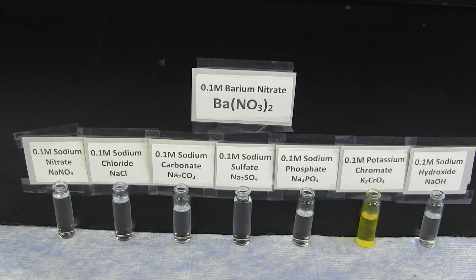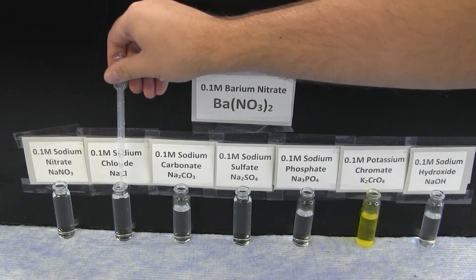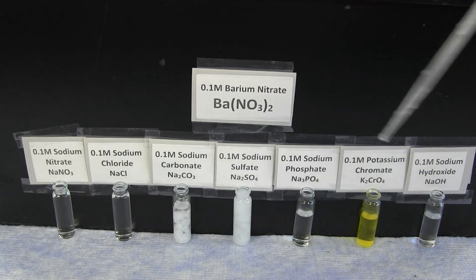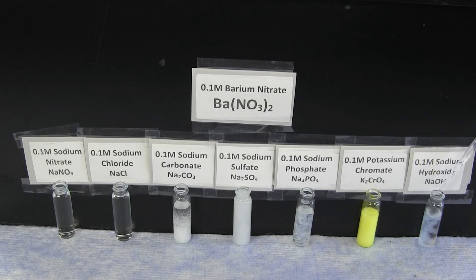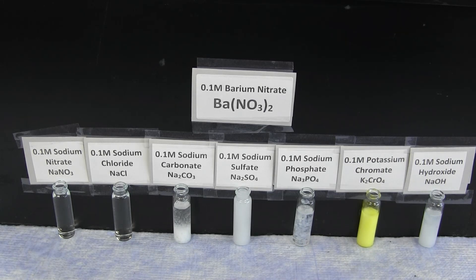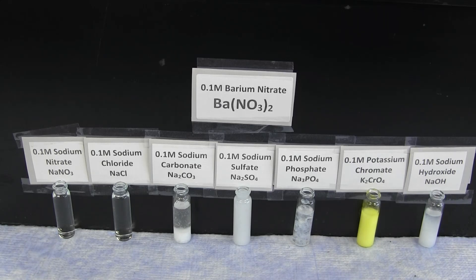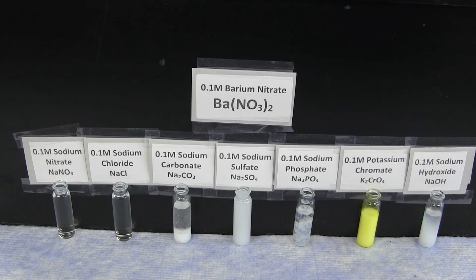The next reactions are those of the barium ion. The barium ion forms a white precipitate with sodium carbonate, sodium sulfate, sodium phosphate, and sodium hydroxide. It also forms a pale yellow precipitate with potassium chromate, and there is no reaction with sodium nitrate or sodium chloride.